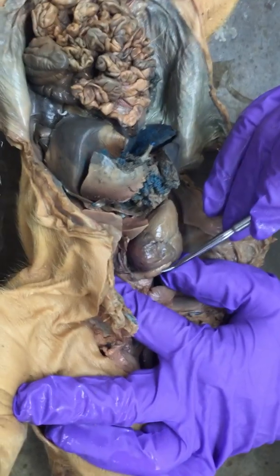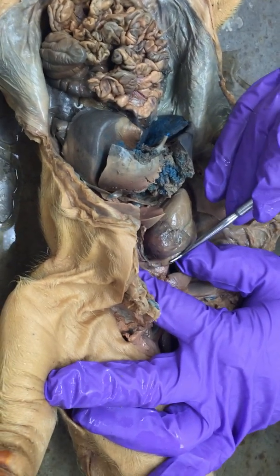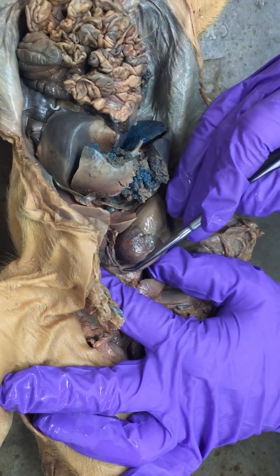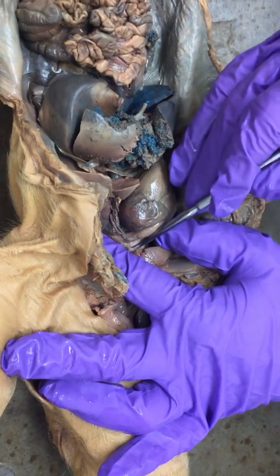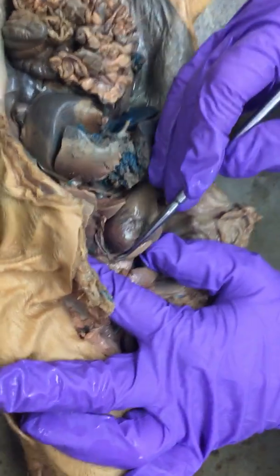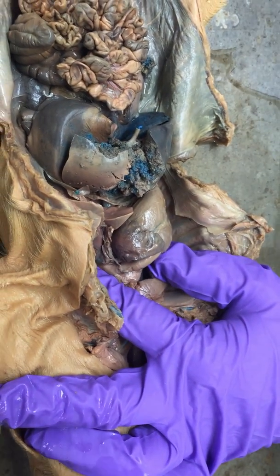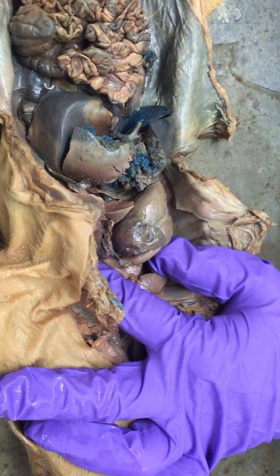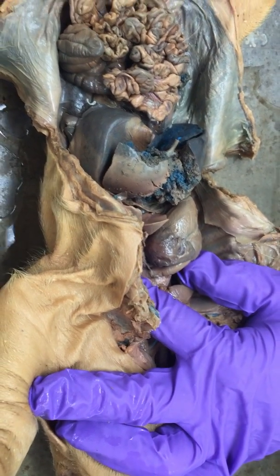So I'm not sure what the best view is, but this is the aorta. This is the pulmonary trunk. This part right here is the ductus arteriosus because it's allowing blood from the pulmonary trunk to go straight into the aorta. You see that? Here's the aorta. Blood can go straight into the aorta. Here's the aorta here. So that's the ductus arteriosus. That goes away and leaves behind the ligamentum arteriosum. Okay, cool. Is that it?